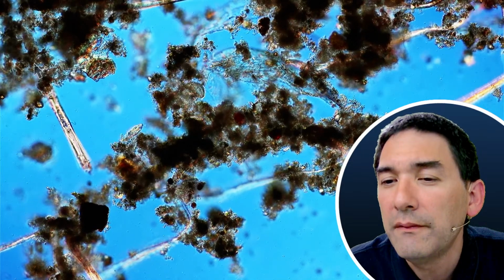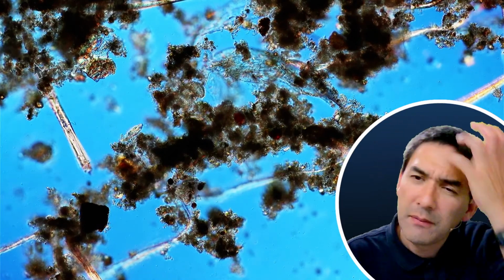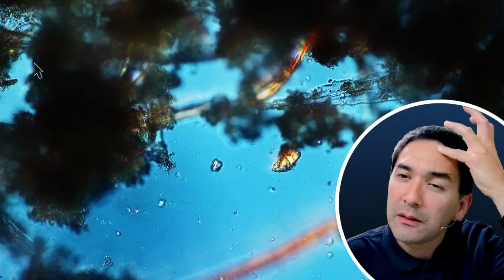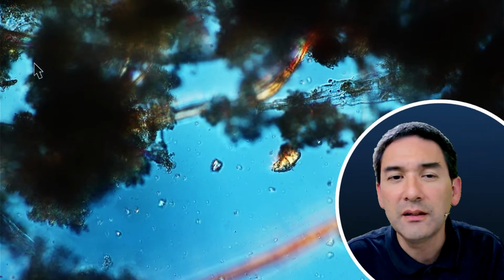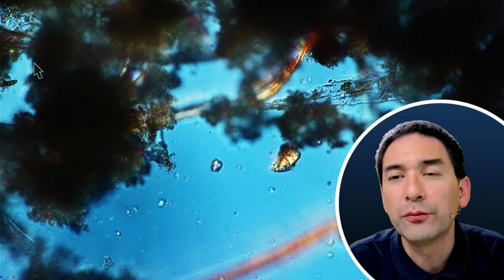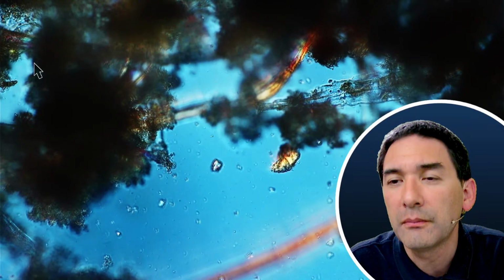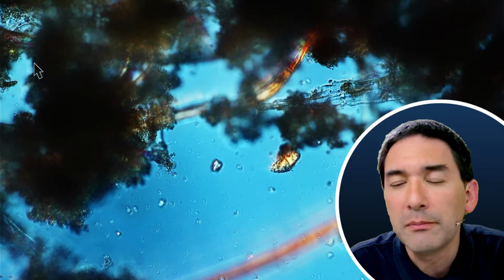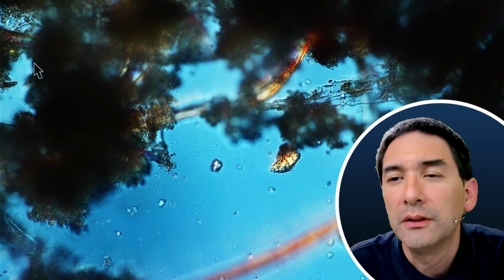Okay, could you make a video about DIC, please? That's a long topic as well. DIC is the technique that I'm using right now here. It's differential interference contrast microscopy. I've had it planned, but maybe I'm going to make a video in my other channel for this, because it's more technical in nature.